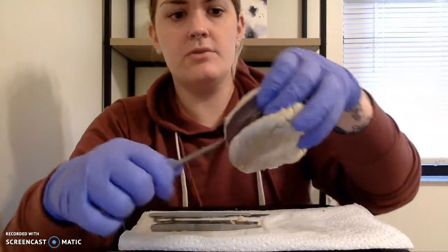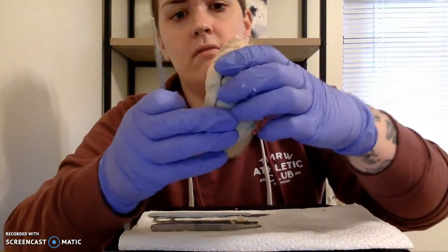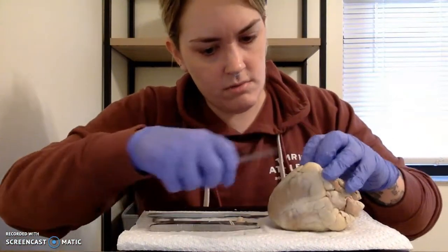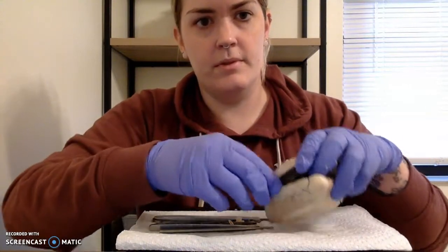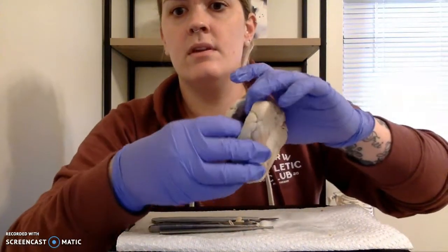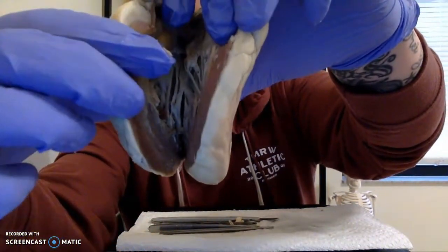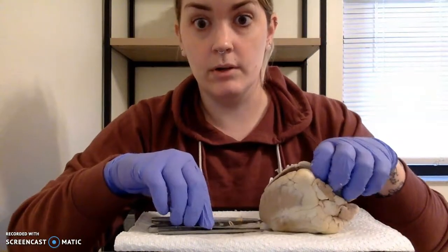You can see here I've not actually cut through it because I did want to keep our left ventricle and right ventricle separate. Hands-on labs did not like the idea of just cutting right through it. Let's see if we can make that a little clearer. What this does give you a beautiful view of is the chordae tendineae, that stringy substance that attaches the valve to the walls of the heart. I think I should have ended up just cutting this in half, but we're going to go with it.